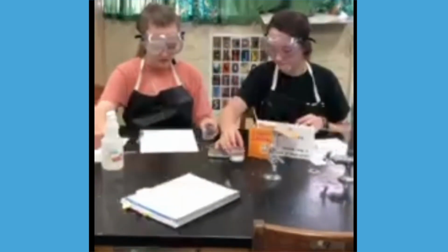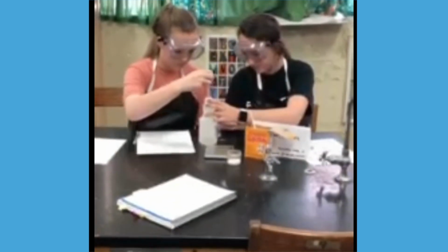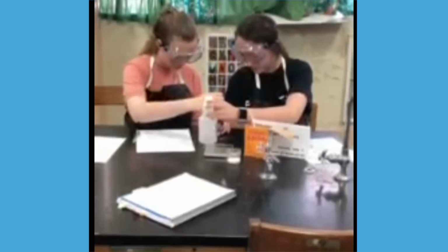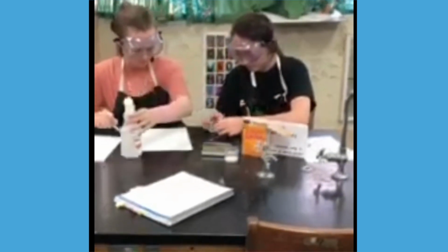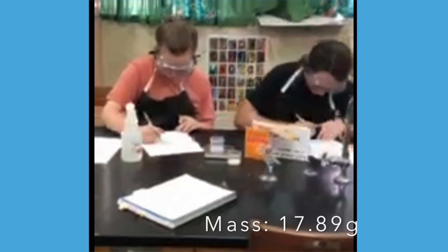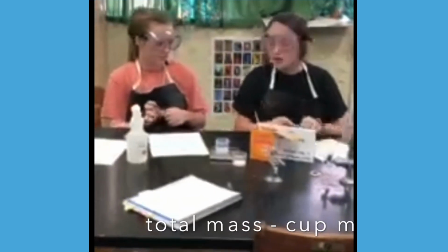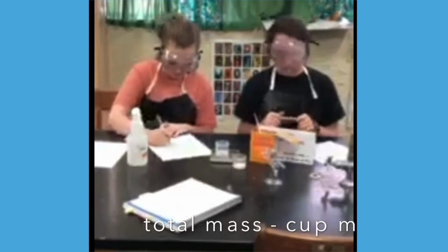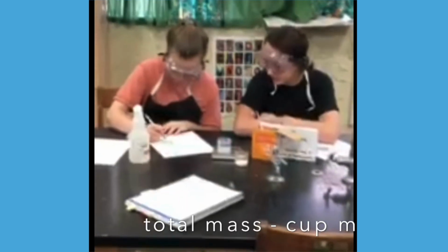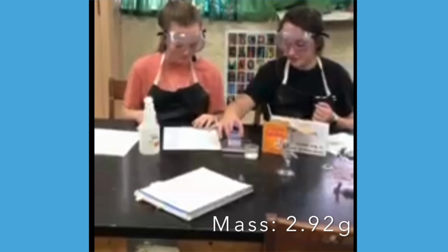Now we're going to put 3 milliliters of vinegar into our other cup that we have. We're going to find the mass again. 17.89. Now we're going to subtract 14.97 grams from 17.89. 2.92. Okay, so that's the mass of the vinegar.